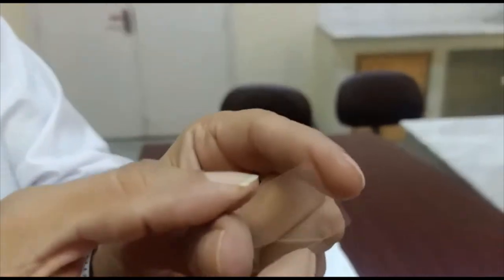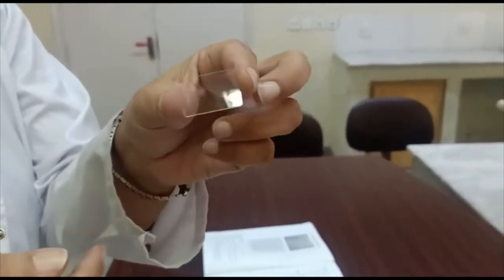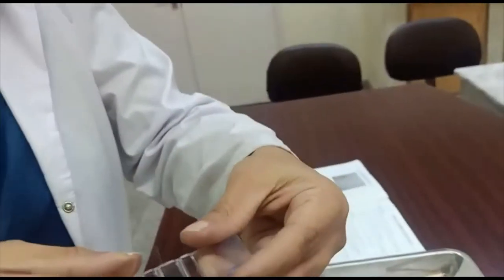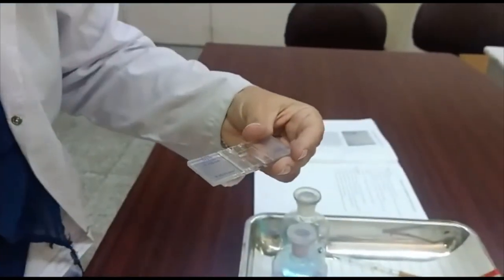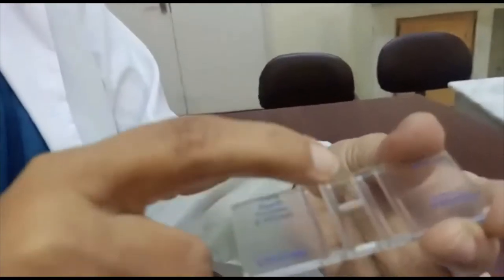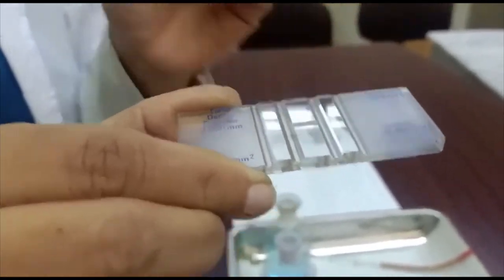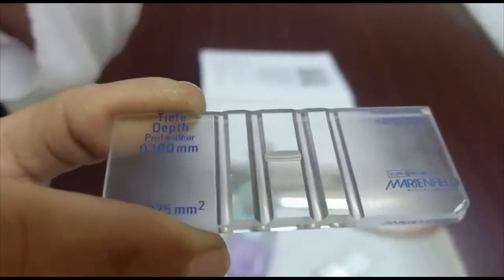Next is the cover slip. Always hold the cover slip from its edges and sides. We should not hold it from the flat surface because our fingerprints will come on the cover slip. So we hold it from the edges and place it over the ridges of the Neubauer chamber. When examined under the microscope, we find grids or markings, which I will explain after a while.